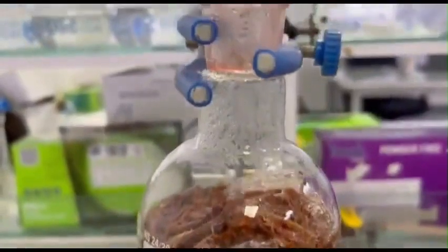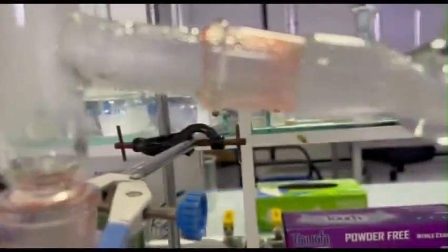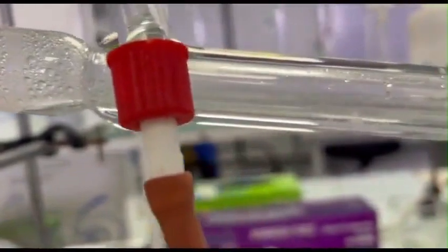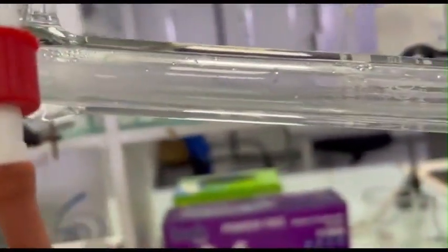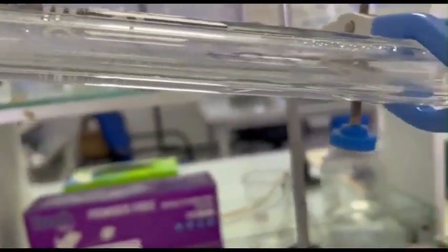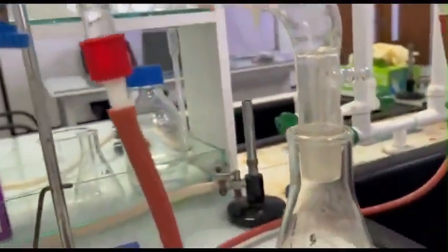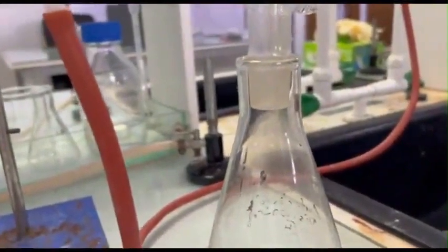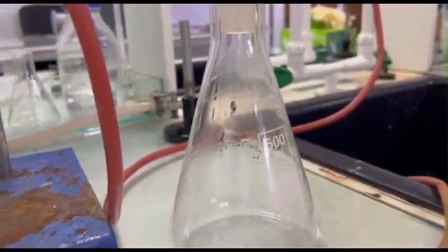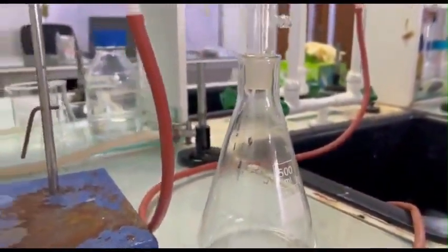We have sealed the whole system using grease. Then we can turn on the Bunsen burner and let the water inside the round bottom flask boil, and at the same time we also turn on the tap to let water in. Here you can see steam collecting inside the condenser due to evaporation of the organic compound mixture, and a mixture of oil condensate, which is cinnamaldehyde, and water collecting in the conical flask. Now we are done with the extraction, and here you can see our essential oil extract.